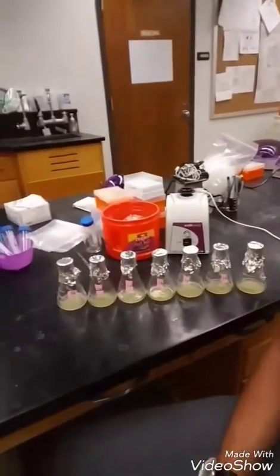So for my transformation, I put my virus's DNA into a bacteria called E. coli. I let the E. coli grow up overnight in something that we call a shaking incubator.